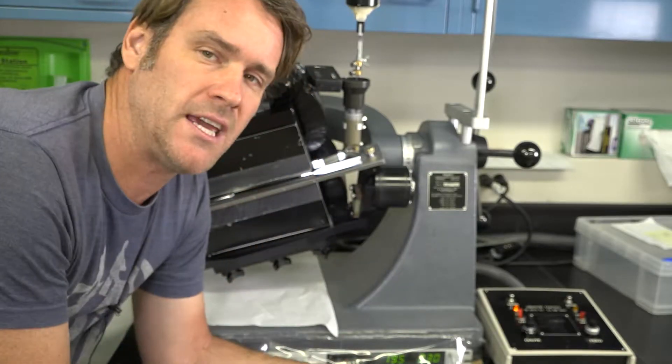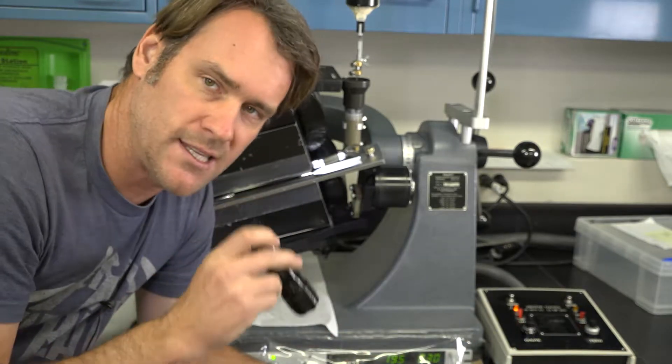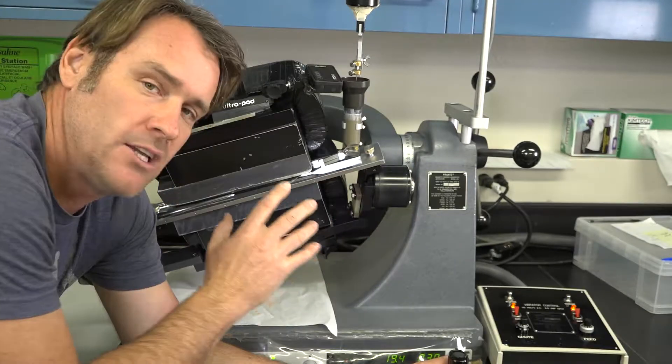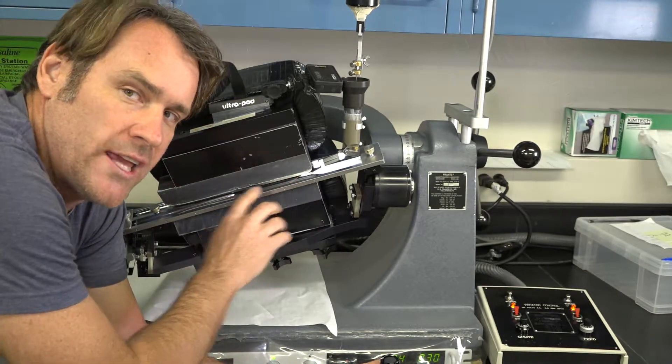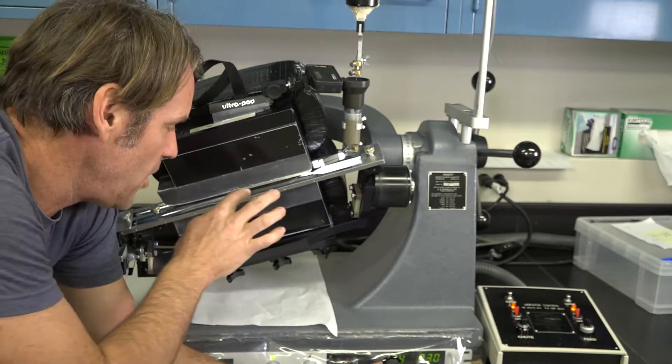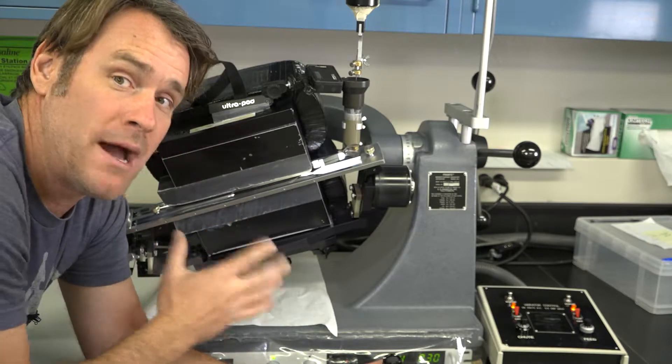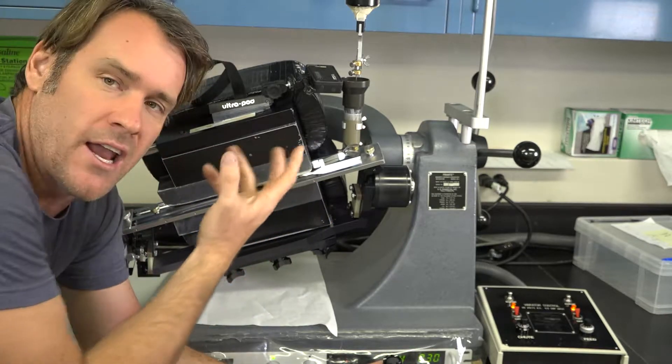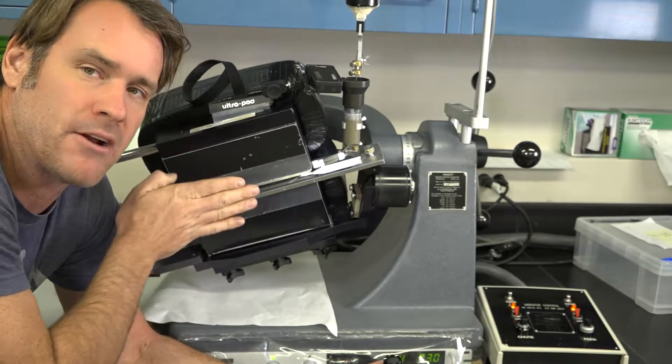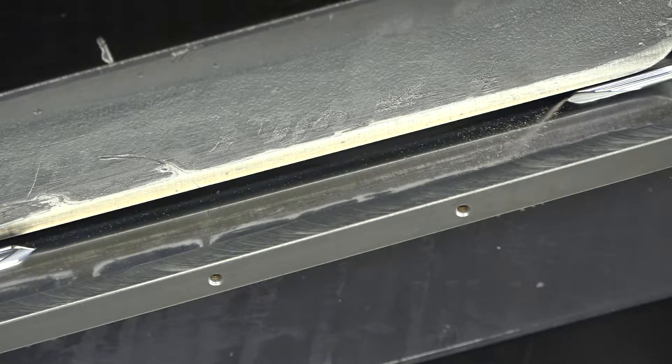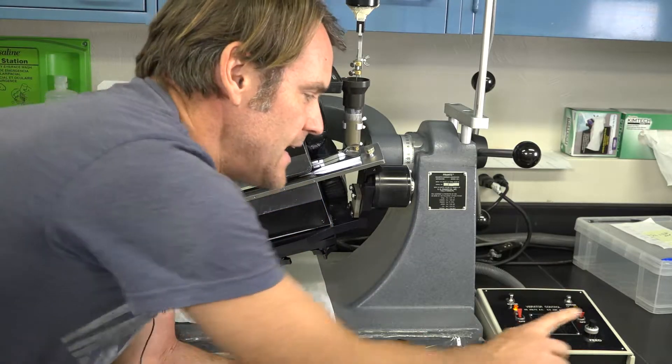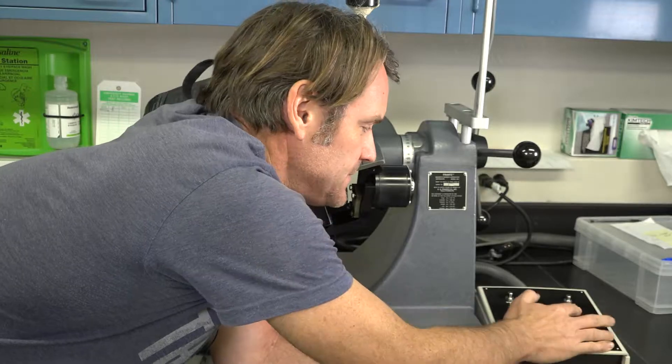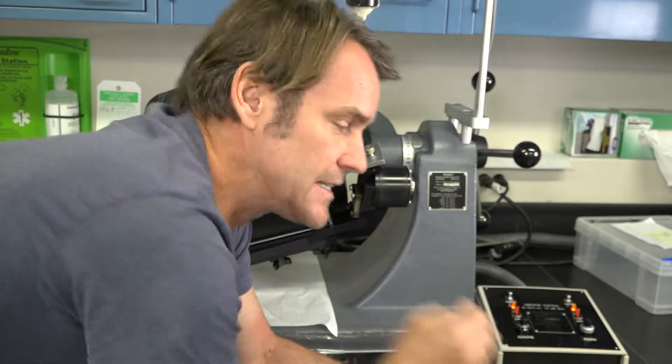You can bring this up and watch the chute. Pretty much every time you pour a sample in, a little bit is going to spit out. And that's just enough. You can actually see how the system feeds. Another great thing you should have while you're trying to adjust the feed is a nice strong LED flashlight because that will allow you to really see those sand grains. The whole thing is pretty shadowy. And the way to adjust it is you're going to look at this gap in our main chute and you're going to make sure that everything is falling out in the first third to a half. You're getting no last-minute fallout toward the end of that gap. If that's happening, you might be losing some non-mags because they're not able to trickle out of the sample before it goes back into that barrier. So here you can see a pretty good feed rate. This is a little aggressive, but you'll notice that almost everything is falling out here.